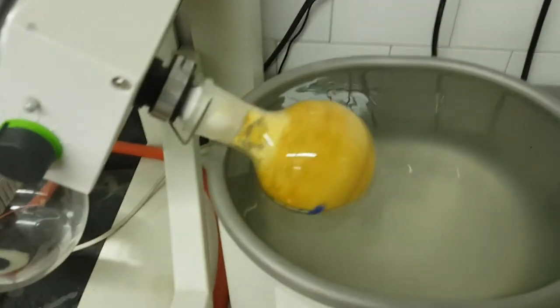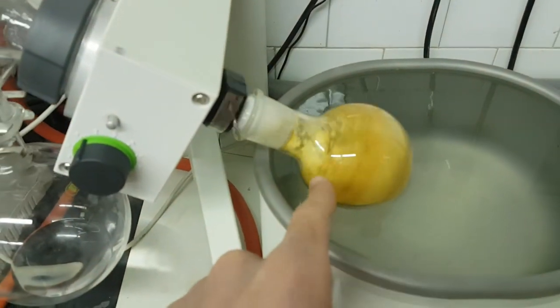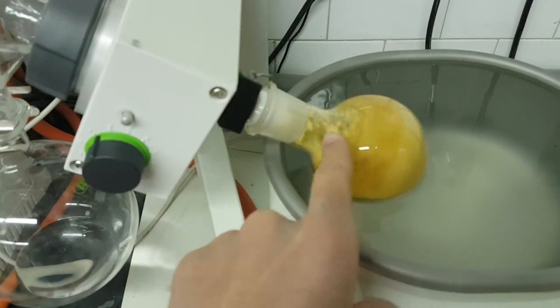And now I think that my sample is really adsorbed on the silica.